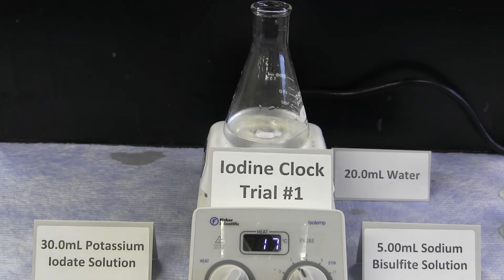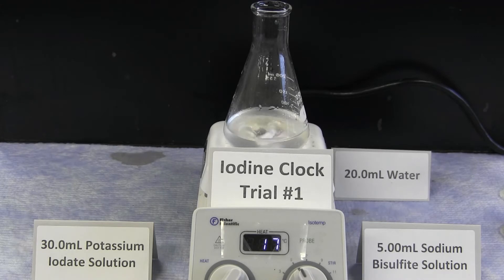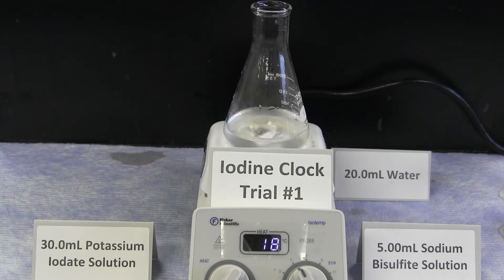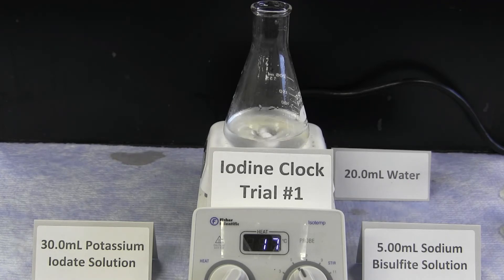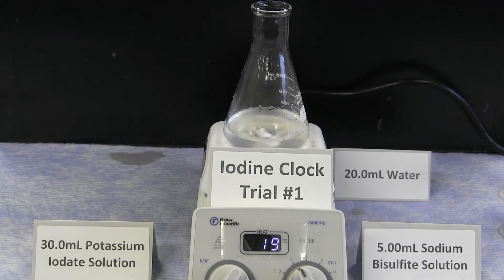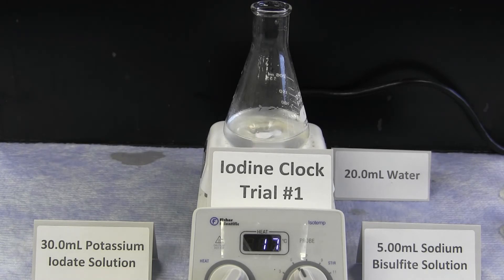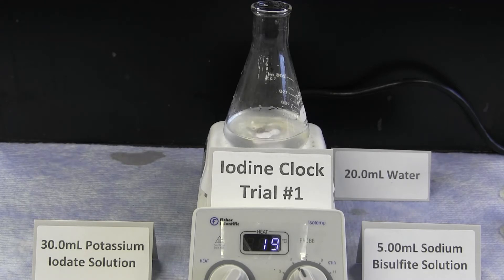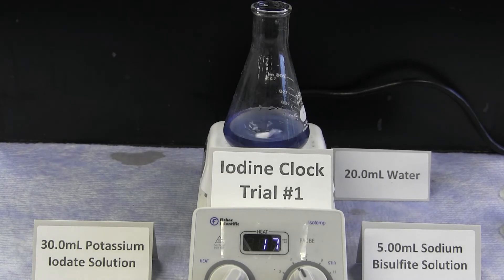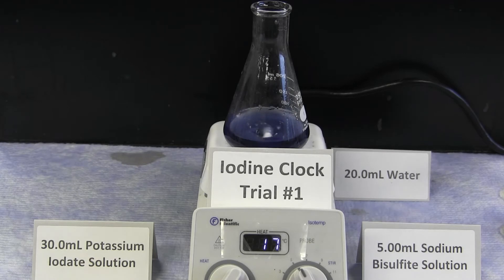It is important to note that the potassium iodate solution is combined with water first and the two reactants meet each other in the last combination. As the concentrations have been decreased, the time it takes for the reaction to occur is increasing. The presence of the blue iodine solution indicates the reaction is complete.